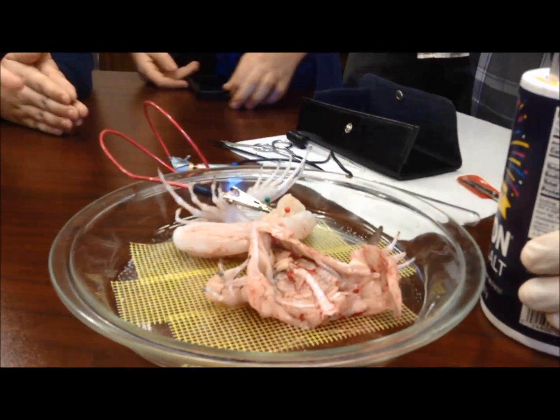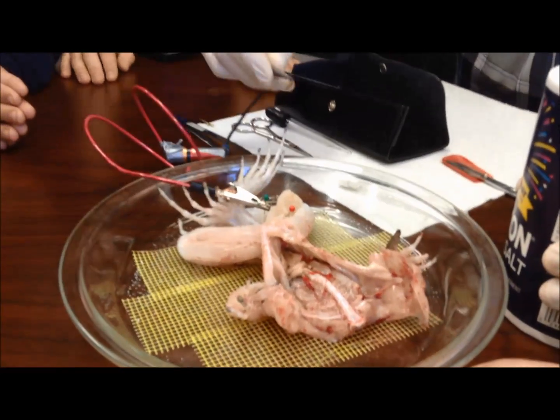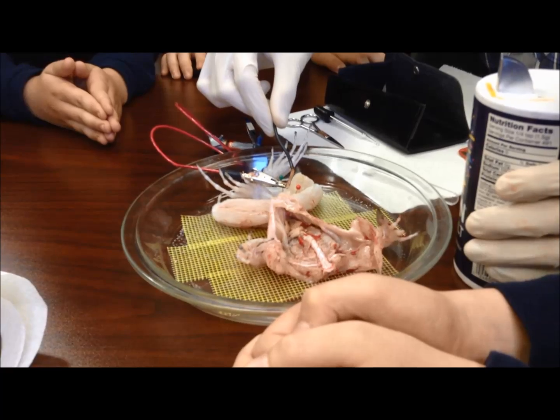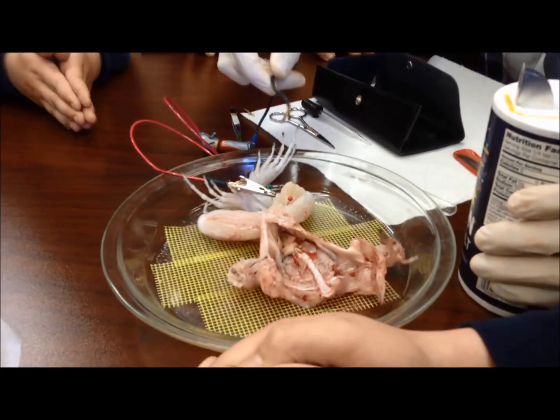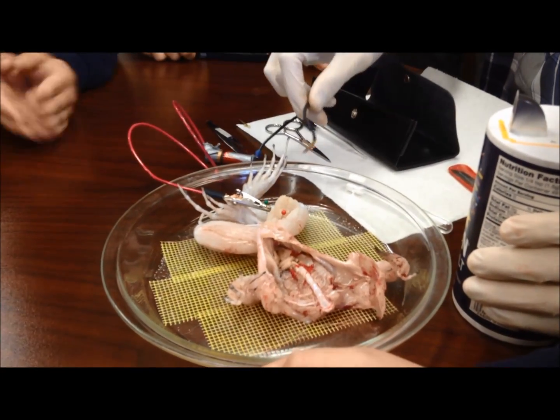It's kind of like an energy — it helps the cells become active. So let's try this now, let's see if it works. Oh! So if we had a soccer ball, it probably could kick it very far — a little frog soccer ball. This is epic! Keep on touching it. It's just like dancing! That is so weird!